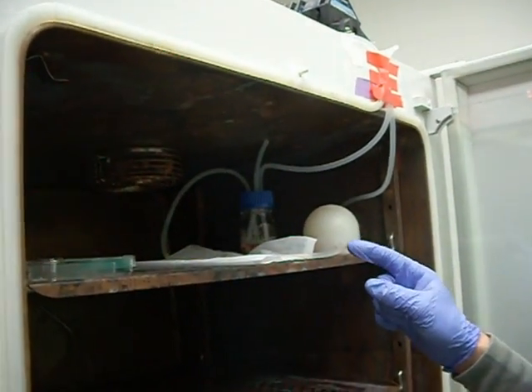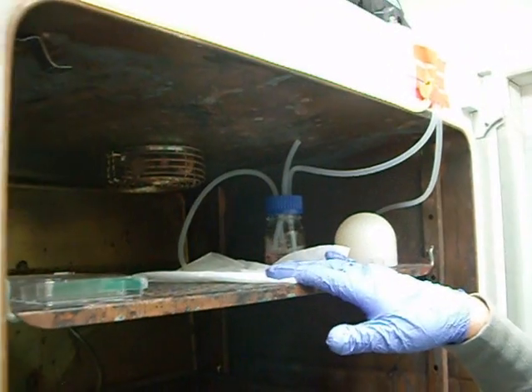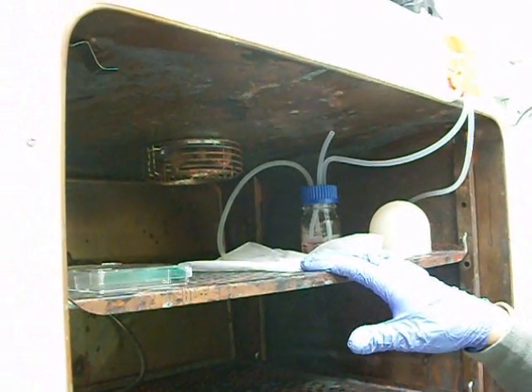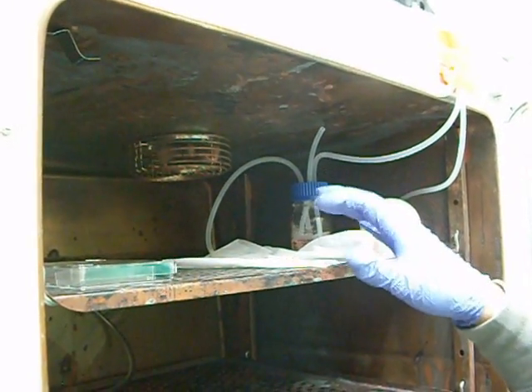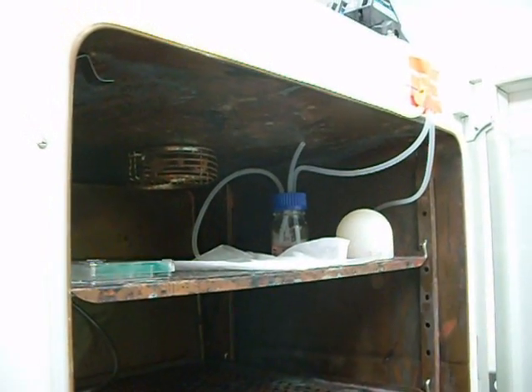Go ahead and let the pump run. Make sure you get any air bubbles out of the tubing. And go ahead and place a chem wipe or something here to catch any media spillage when you actually assemble the chamber. We'll leave this here and go get the chamber ready now.